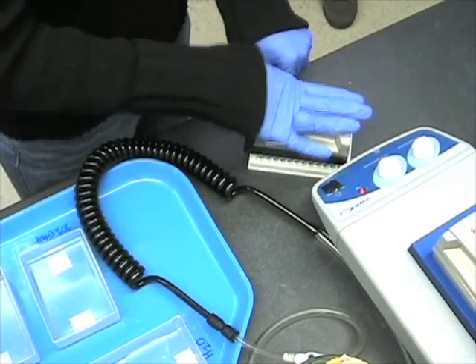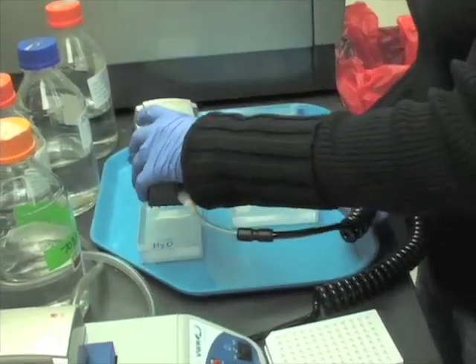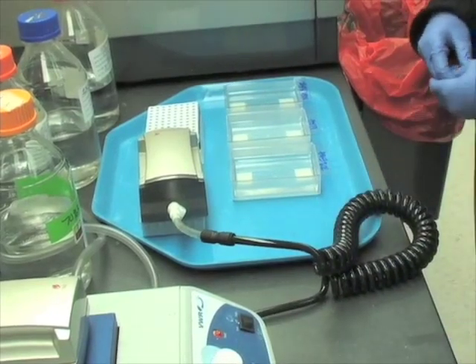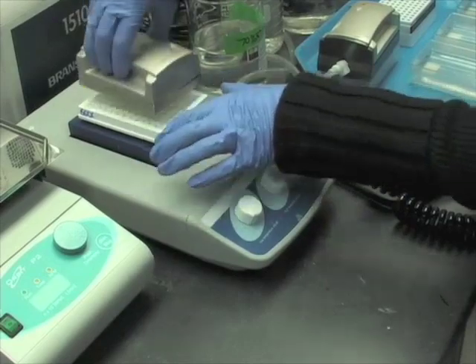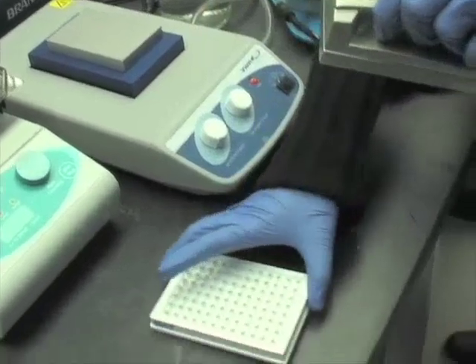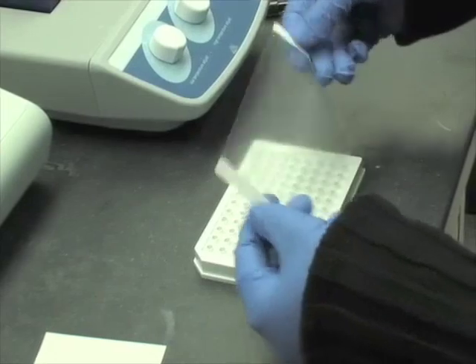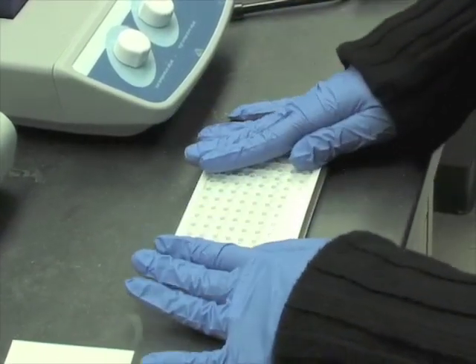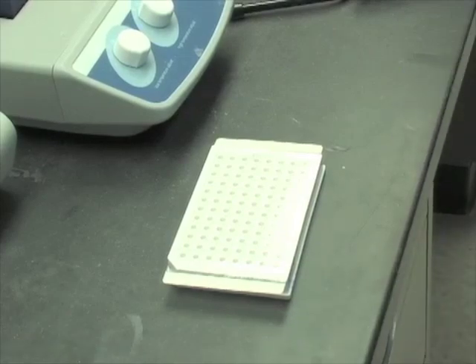Remove the vacuum tool from the pyrosequencing plate once the shaking or rocking is complete, and reconnect the vacuum tool to the hose and place the tool into clean water to cleanse it for the next plate. Place the pyrosequencing plate on a heat block for 2 minutes at 80 degrees Celsius. After 2 minutes, remove the plate from the heat block and place on a cool surface. Once cooled, an adhesive film can be used to cover the plate unless the plate will be run within 15 minutes, to prevent evaporation. And now it's time to begin pyrosequencing.